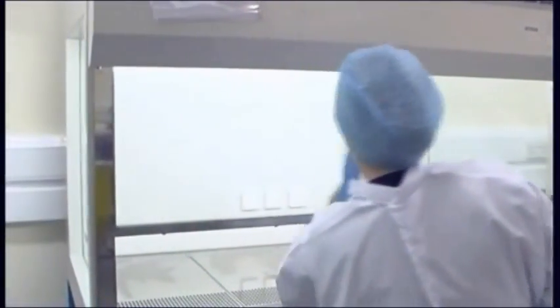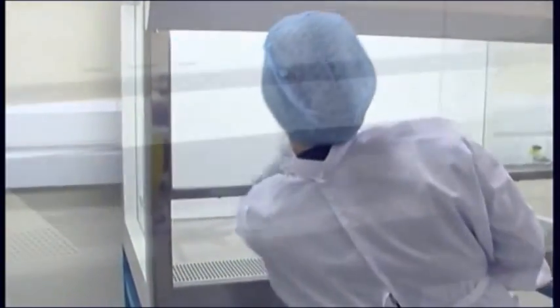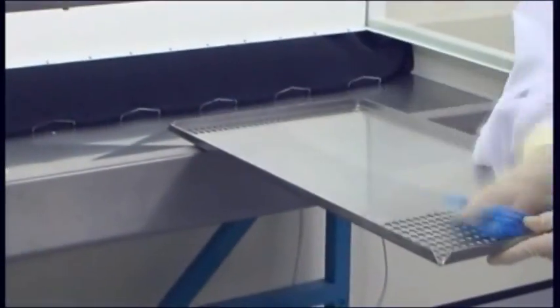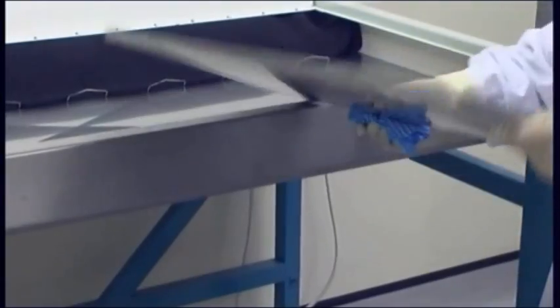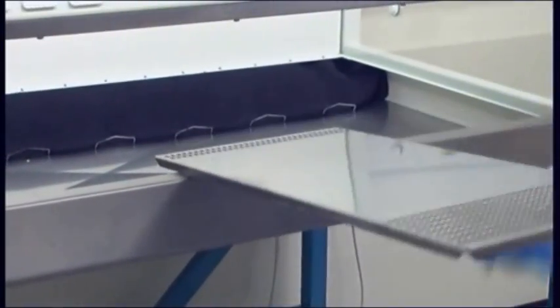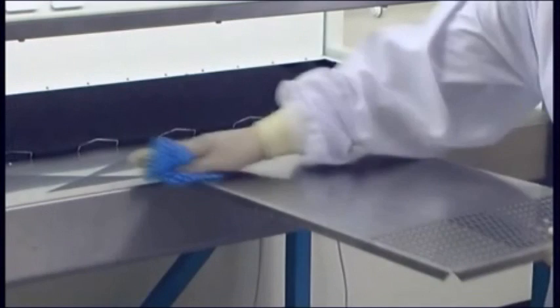Once a week, clean the cabinet thoroughly with an effective disinfectant solution, remembering to remove the base plates and clean underneath. This should preferably be done at the end of the week, leaving ample time for the cabinet to re-establish over the weekend.